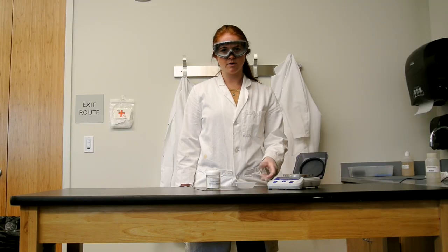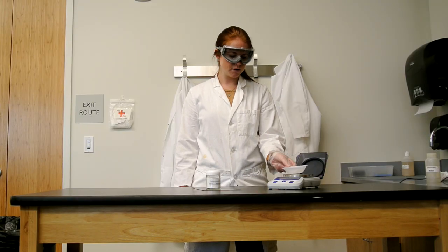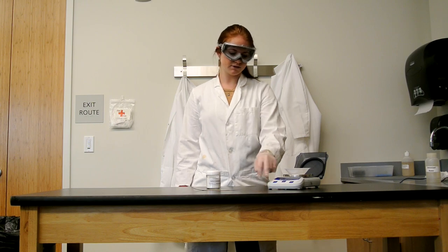In order to measure solids, you need a weigh boat to contain the solid. Place the weigh boat on the scale and zero the scale again.